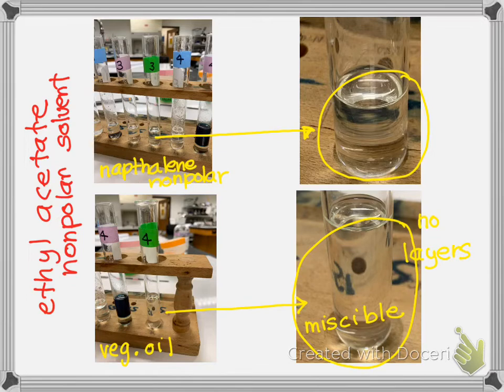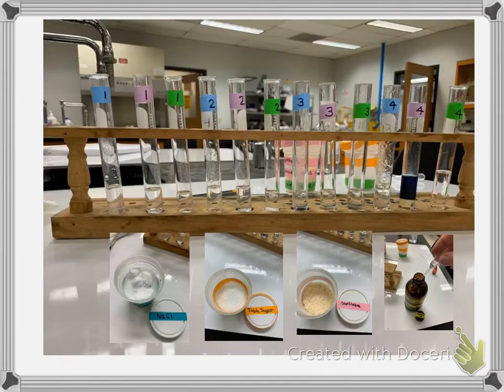So this completes part C of Lab 15. You should have recorded in your data your observations based on the pictures that I have. Now let's look. Oh, I forgot I included this page. I just took a picture of all the final things. I'm not sure that it's meaningful in terms of observations because they're kind of far away. But here's a picture I took.